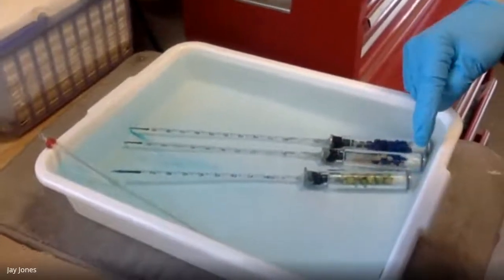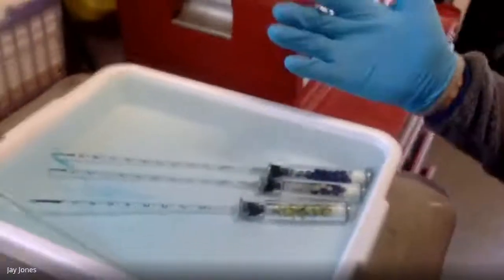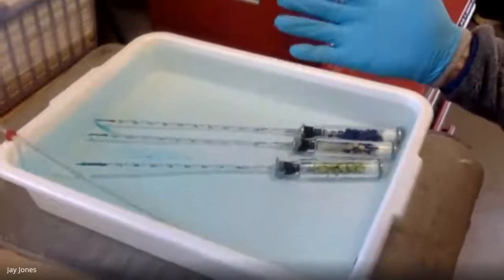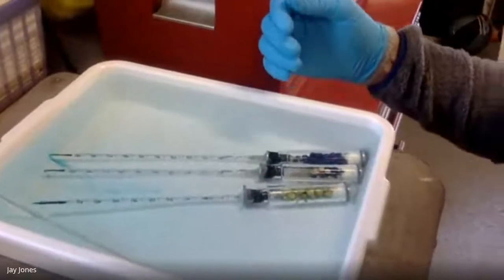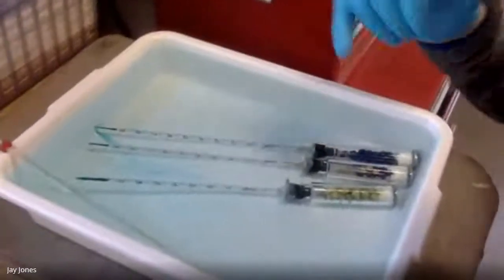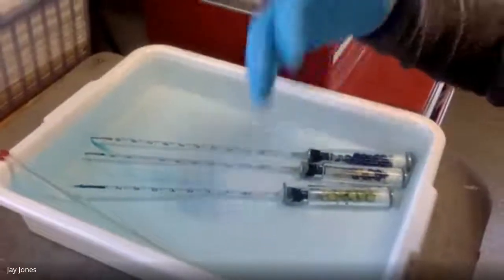The germinating peas consume oxygen and make CO2, but we're taking this CO2 out. The dry peas are dry. They should do nothing, and it looks like they're doing almost nothing. And the beads alone obviously are not living. They don't make any CO2. They don't use any oxygen, right? But they do measure changes in temperature and pressure, which affect volume and therefore make the color move in and out. When we're all done here, we're going to take all of this data from the beads only and subtract it from the living pea vials. And we're going to get a corrected difference. And that's all in the lab.